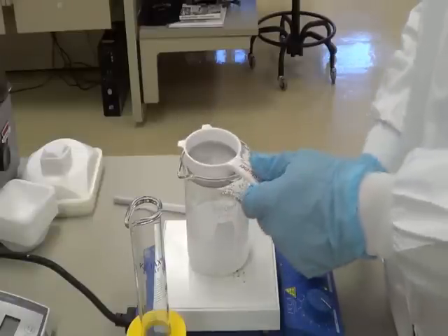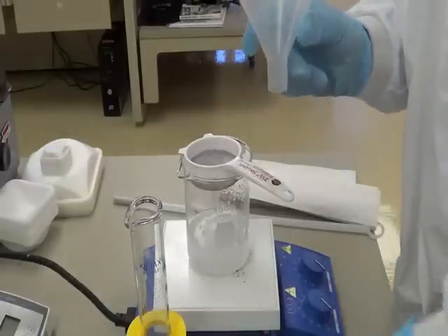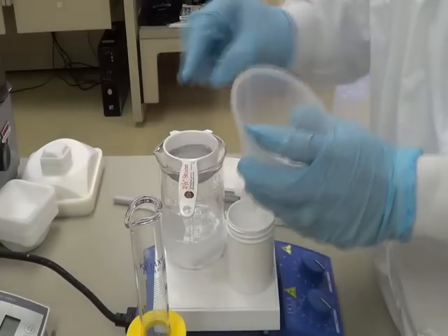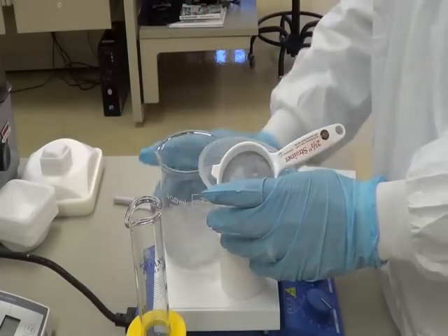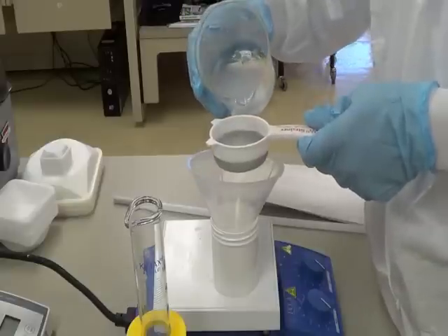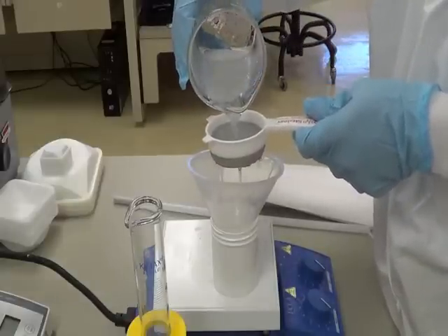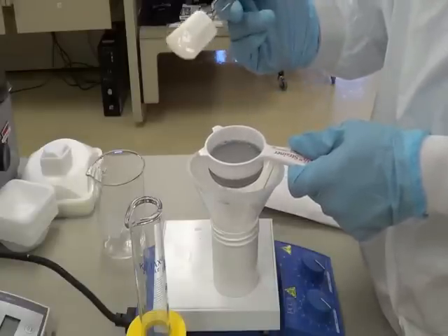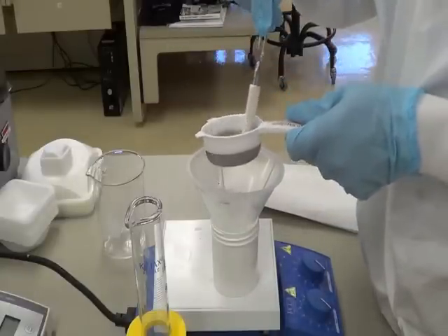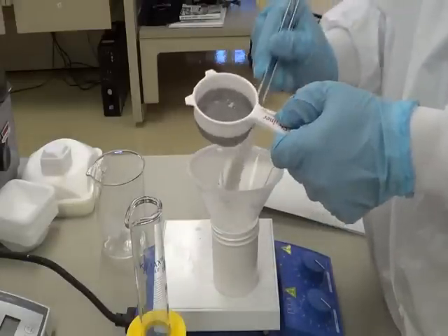Now once I am done mixing it, I am going to use this funnel to transfer all my solution back into this bottle. While pouring it back using the funnel, I am also going to use the sieve because I want a fine texture of my carbomer gel. I am using the spatula to pass all the carbomer mixture back into the bottle through the funnel. Make sure you are transferring all your carbomer back into the bottle.